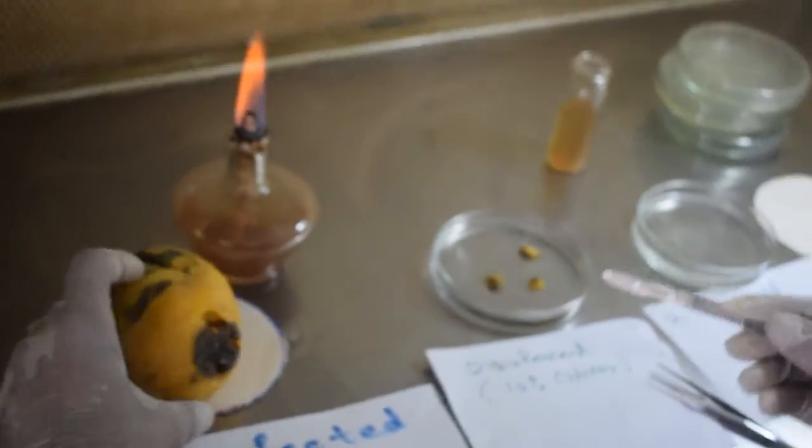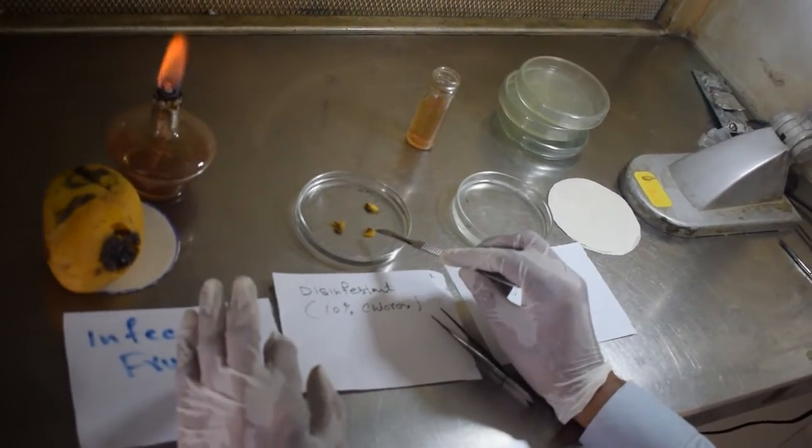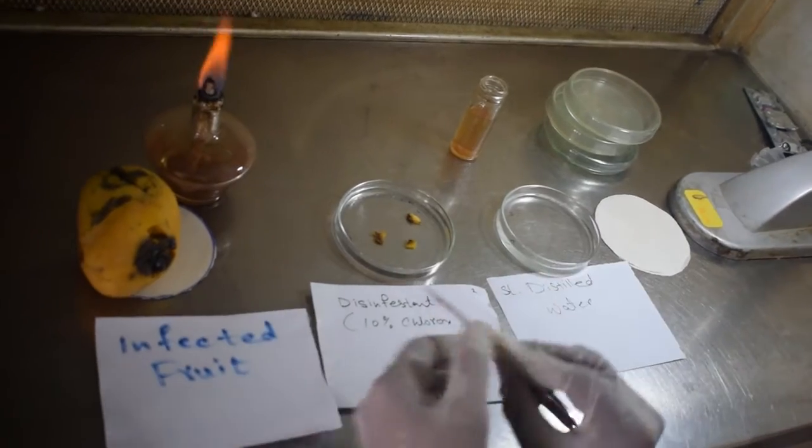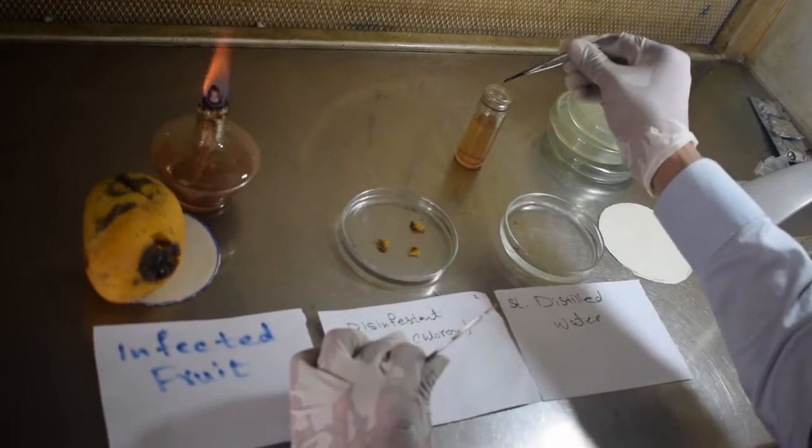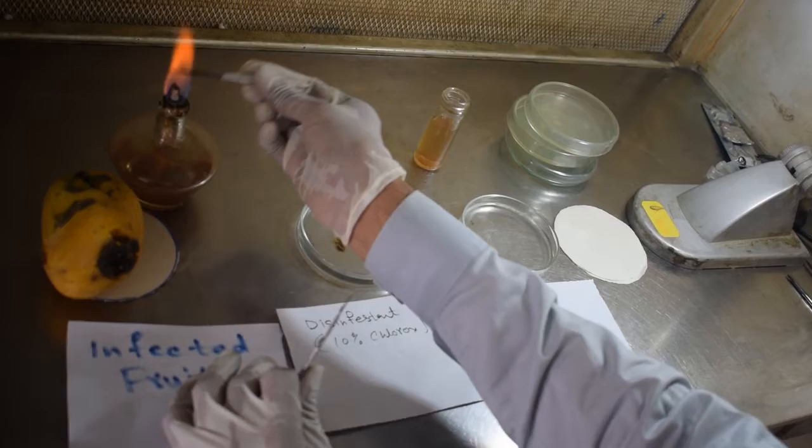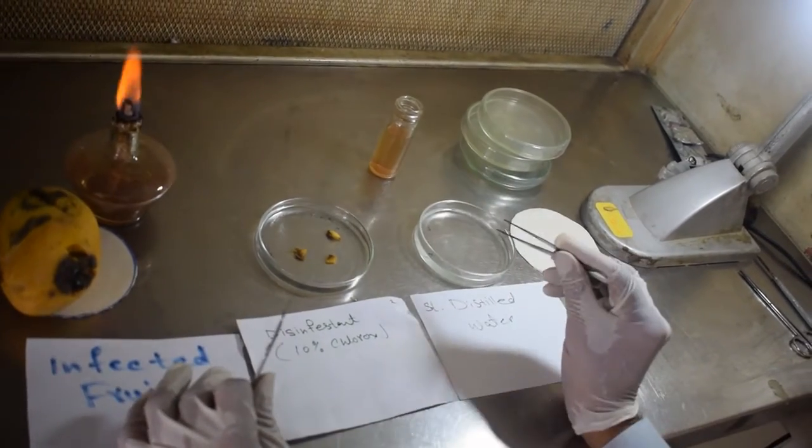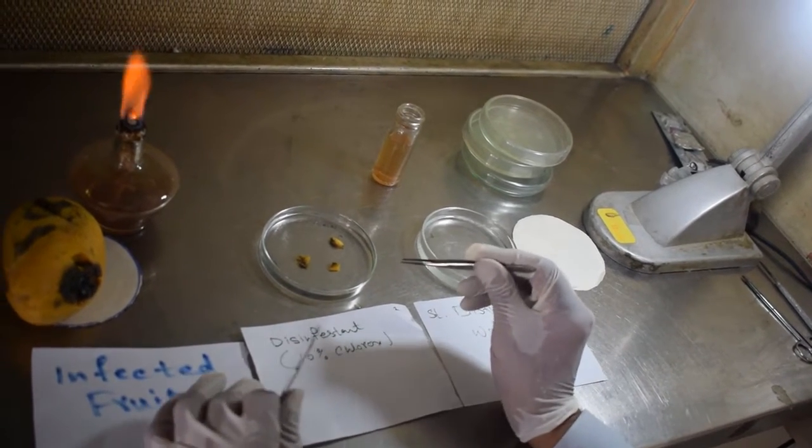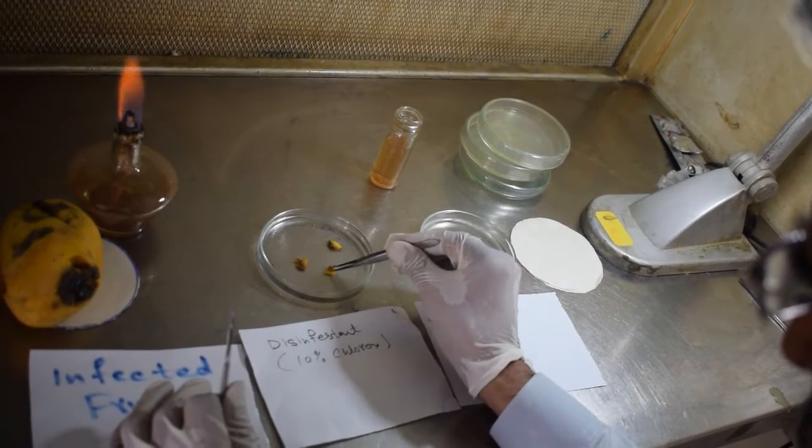So these are the two sides. These are the pieces which I placed in this for 30 seconds, maybe up to 1 minute we can keep them. After that, we should transfer them with the sterilized forceps, being cooled for a while. Now its time is over for the disinfectant.